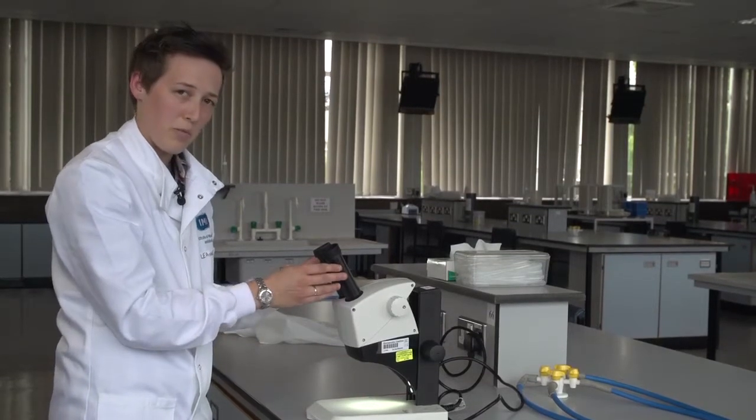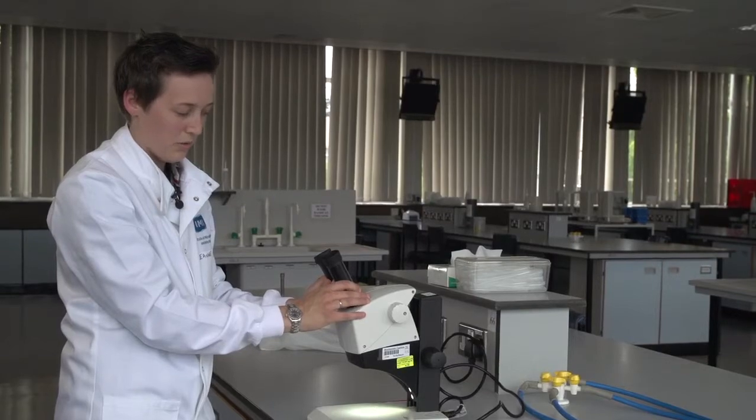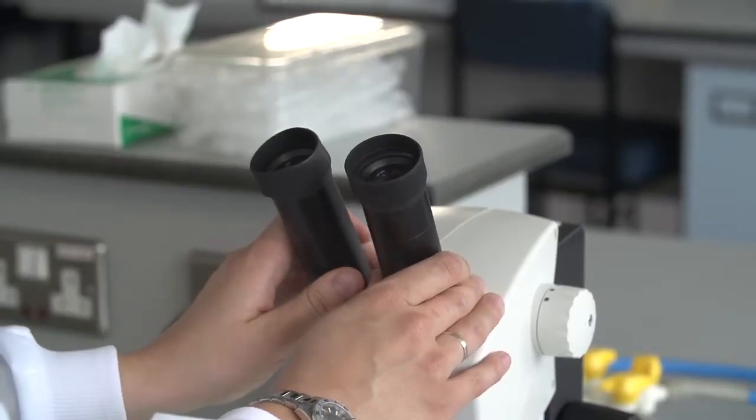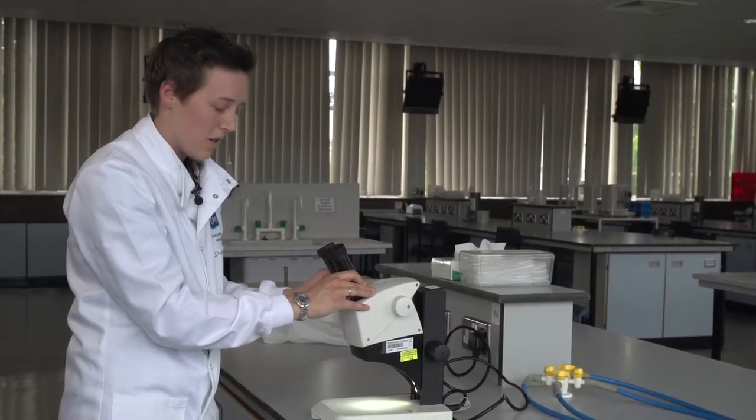Starting at the top we have some eyepieces. These are adjustable to make them more comfortable for you to look through them. You should look through them and adjust them until you can see just one single field of view.